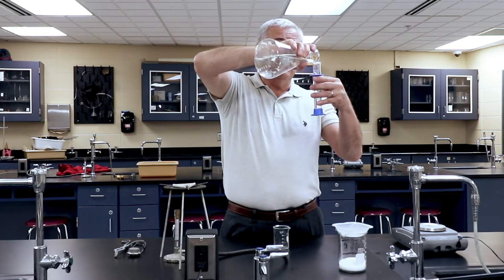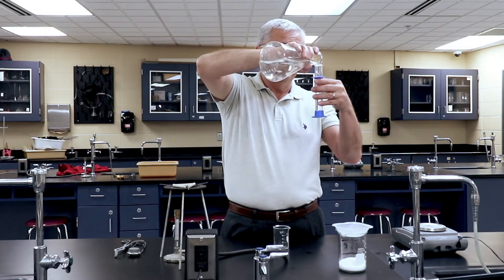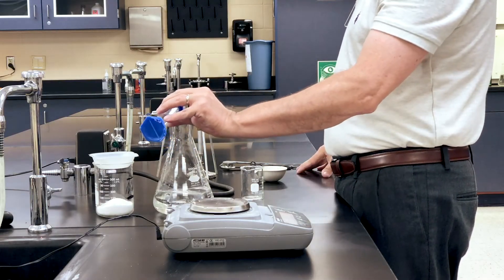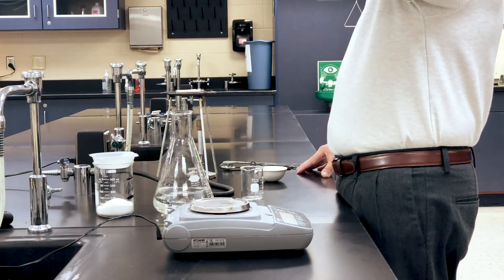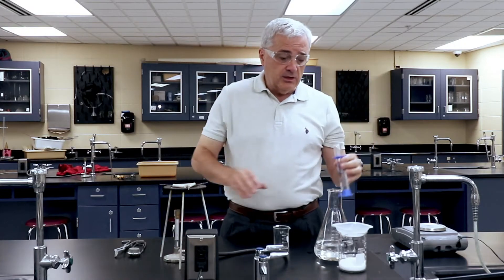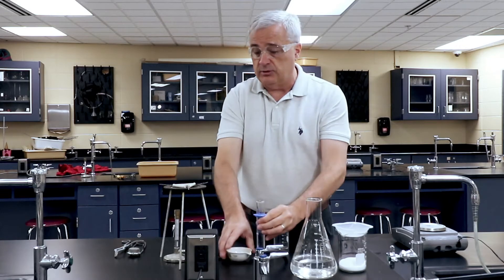This is not like an analytical chemical thing. This is distilled water. I'm just trying to get to about 30 milliliters — not splitting hairs on this. So that's 30 milliliters of water.